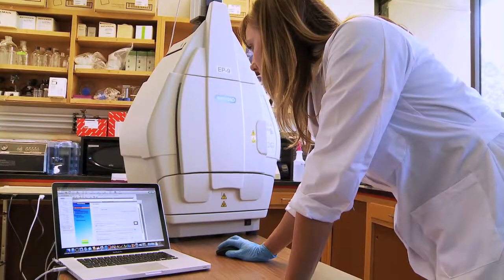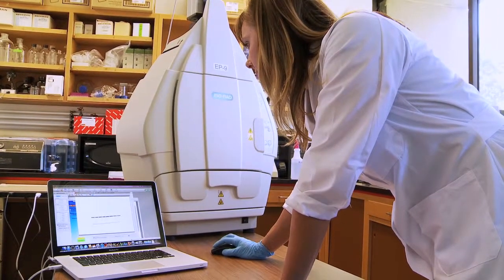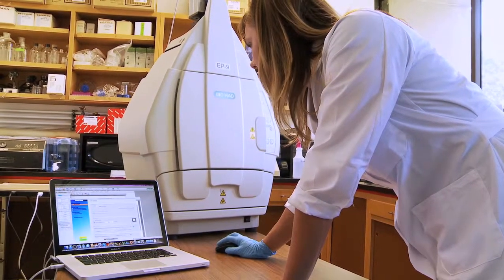With the ChemiDoc MP it just cuts out a lot of steps and everything is faster and more efficient. My goal is to not be a graduate student forever, so anything that makes my day faster and lets me fit more in — it fits into my plan.